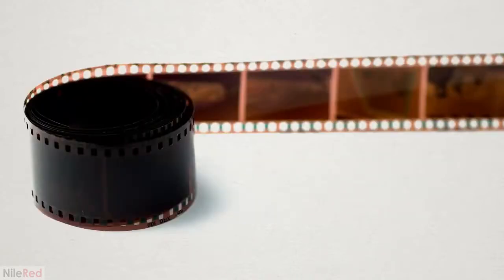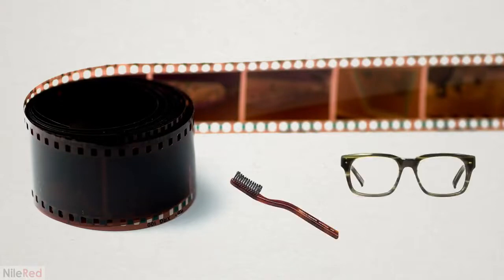Its use now is quite limited, where the triacetate is mostly used for packaging, membrane filters, and some photographic film, and the diacetate is used to make things like toothbrushes, eyeglass frames, and cigarette filters. Still though, I thought it would be something interesting to explore, so for this video I'm going to be making both types and testing out some of their properties.